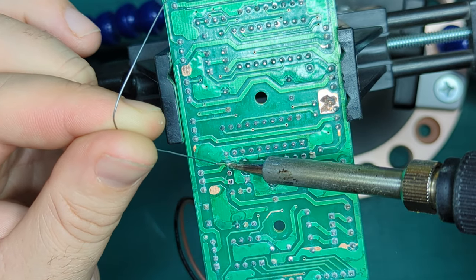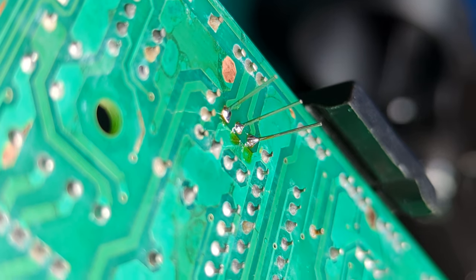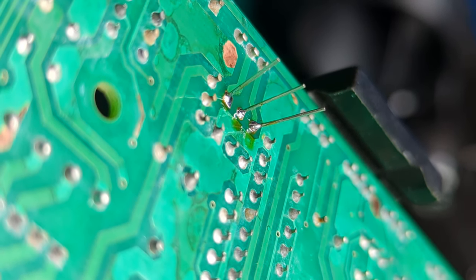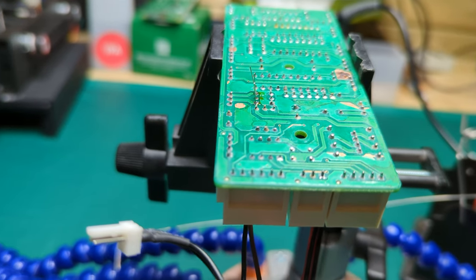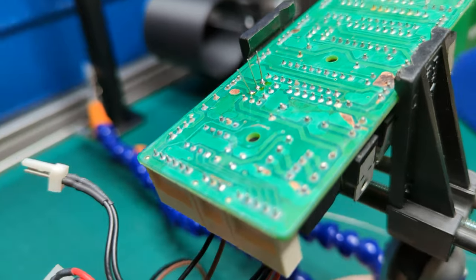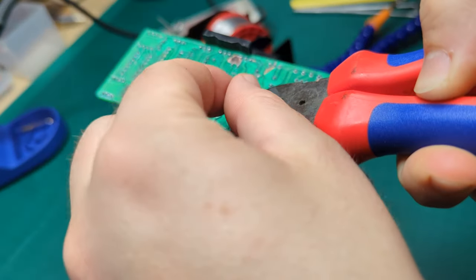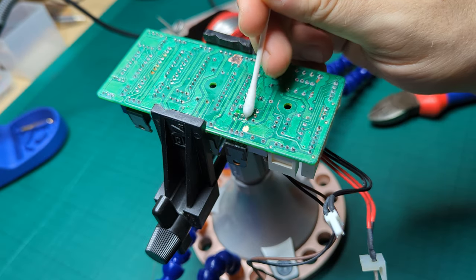If you've not done soldering before, it's actually very easy. The key really is to make sure everything's hot enough before you put the solder in, and you should get those nice kind of cone-shaped bits. The one on the right was the best of the three. All I've got to do now is clip off the bits of the transistor legs that you don't need to stop them shorting out, and clean up the leftover flux with a bit of isopropyl alcohol.